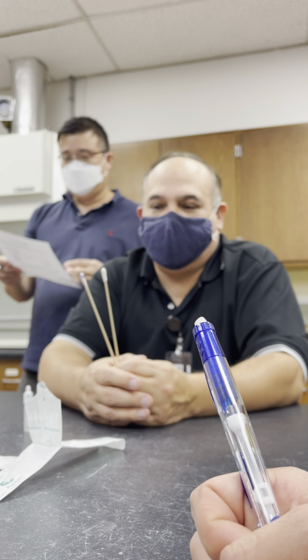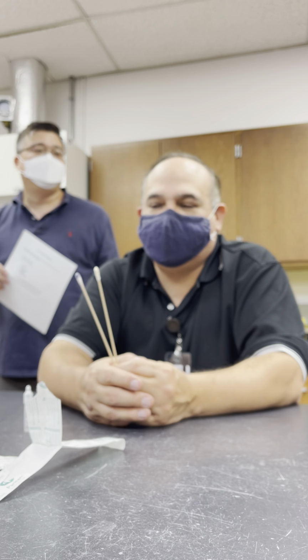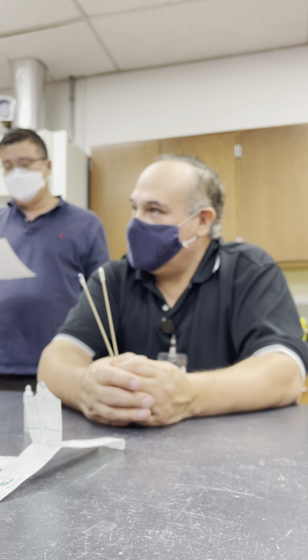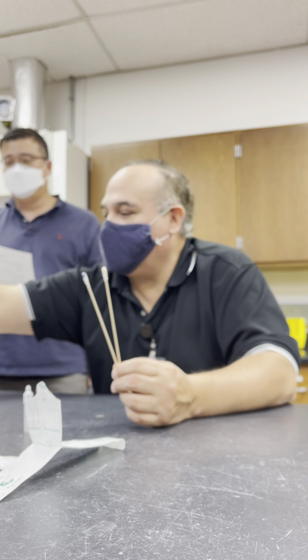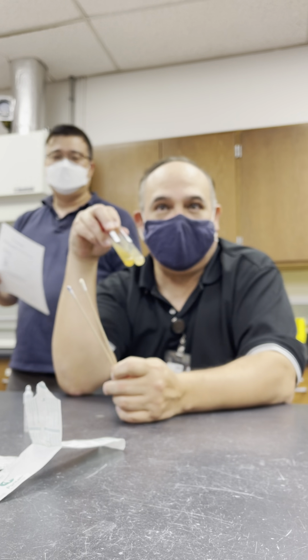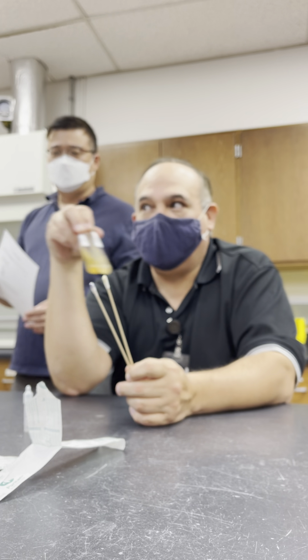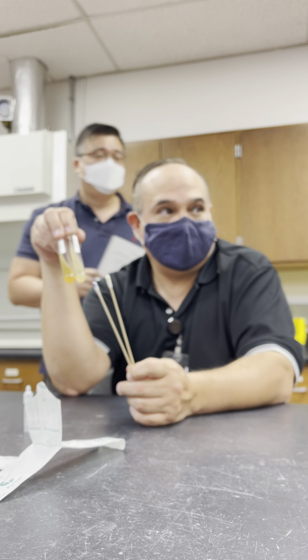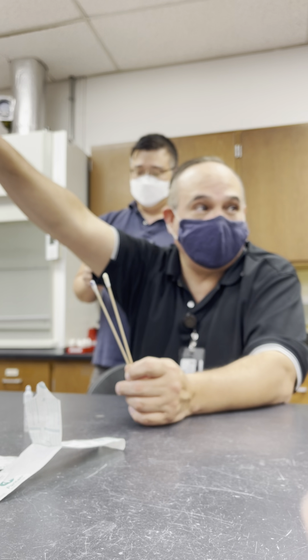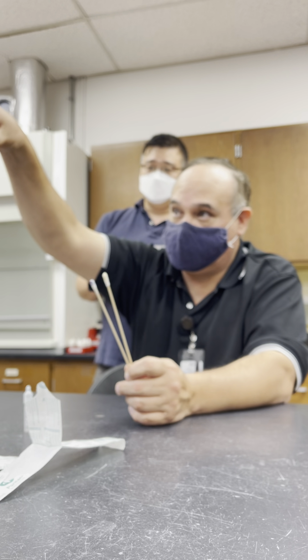Hey guys, so what does faecalis mean? From feces, that's what it means. So can you see that both of these organisms have faecalis in them? That means that they were derived from feces. But they are not enterics, right? Because the definition of enteric for gram-negatives is right over there. These guys aren't going to fit that definition.